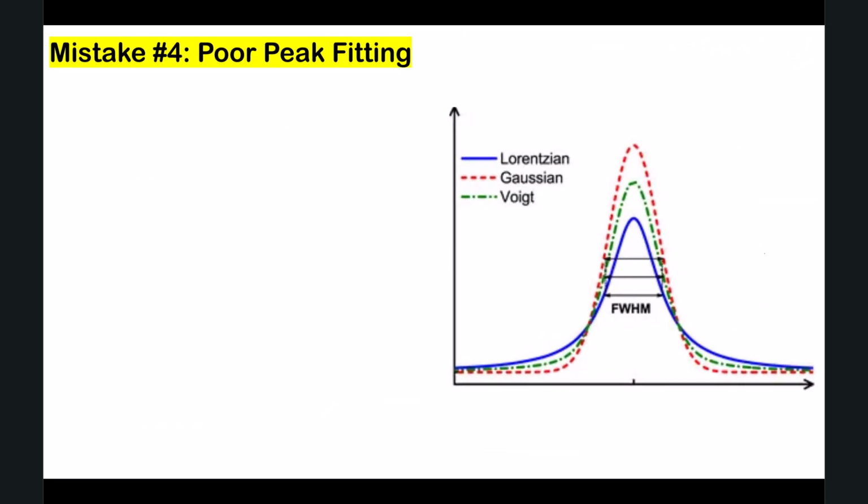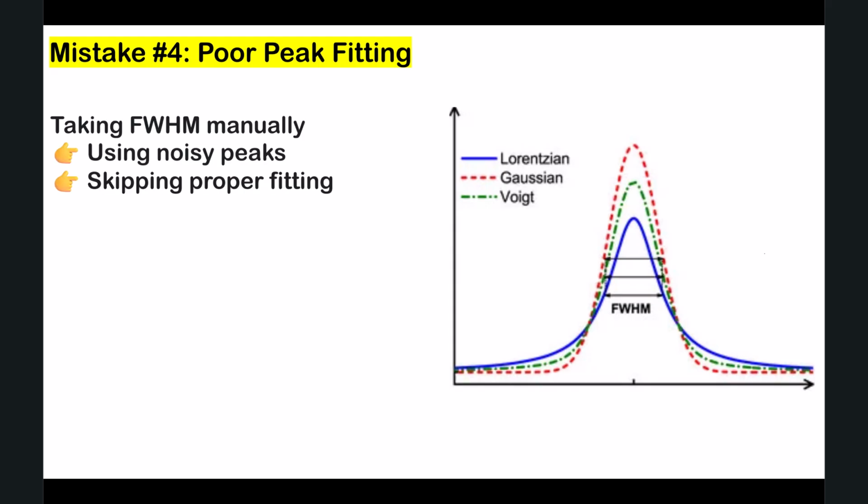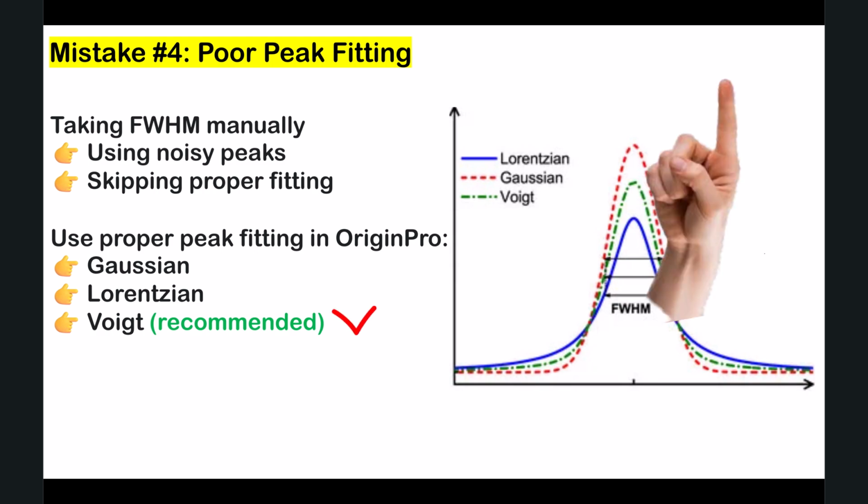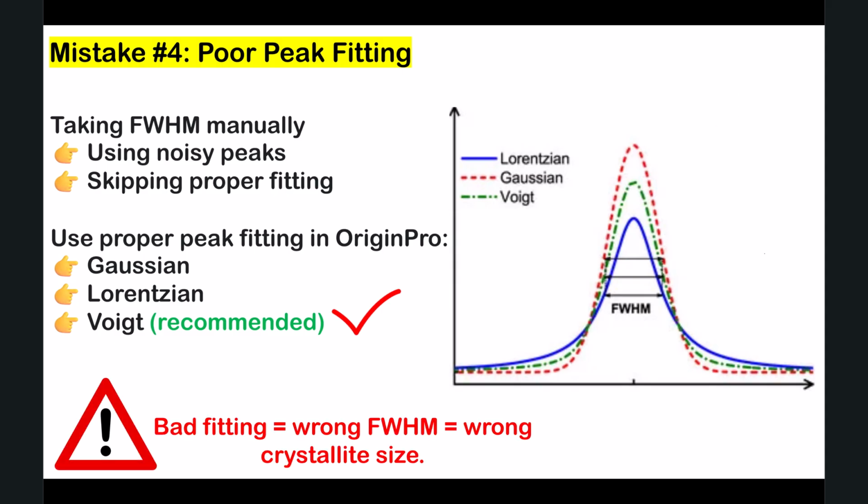Another common mistake is extracting FWHM manually from noisy peaks without proper fitting. This leads to incorrect FWHM and ultimately wrong crystallite size. Instead, always use proper peak fitting tools such as OriginPro. Apply fitting functions like Gaussian, Lorentzian, and most importantly, Voigt. Voigt fitting is generally preferred for XRD peaks as it provides more realistic results. So remember, the better your fitting, the more reliable your results will be.